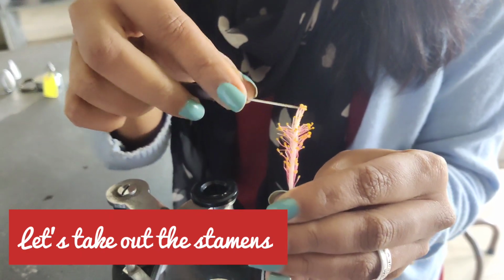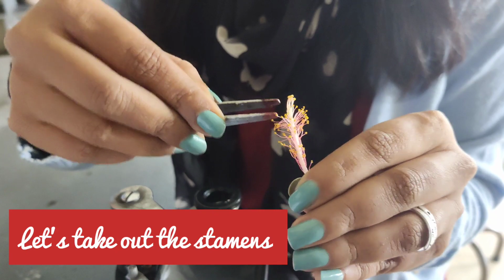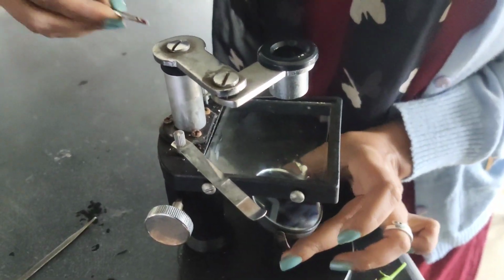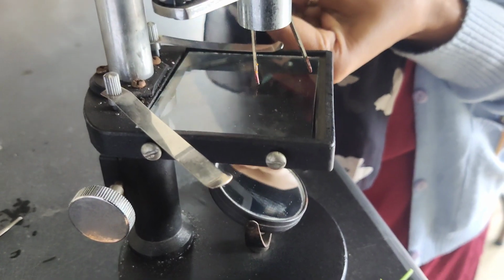I'll just take out one stamen from this forceps. So this is the stamen part and I'll keep it on the stage. This is the stage plate. We're going to keep the stamens.